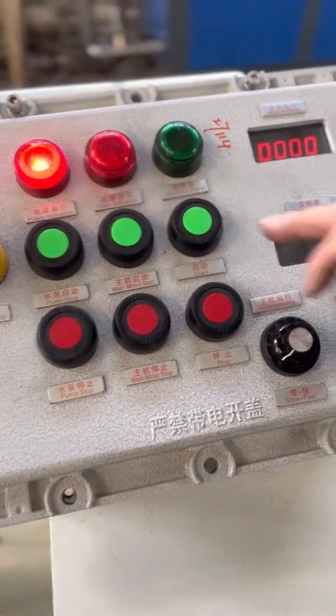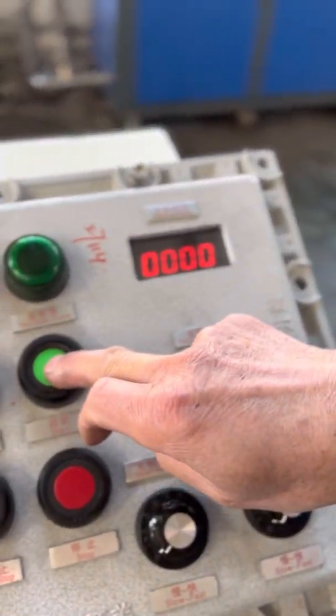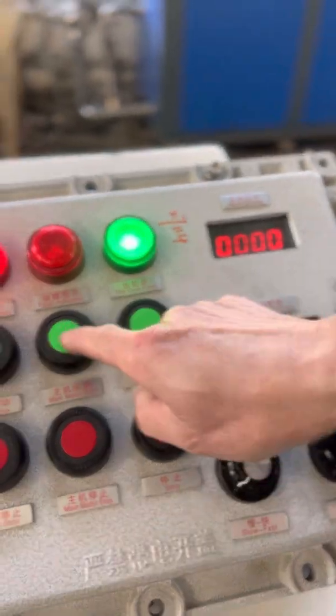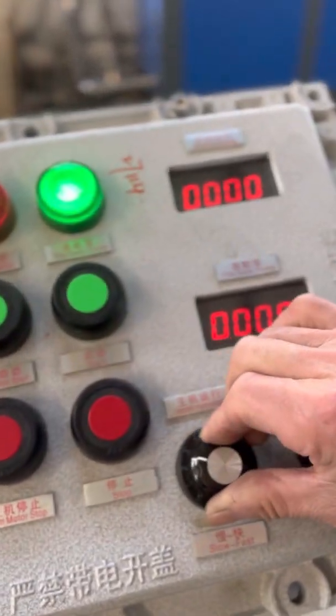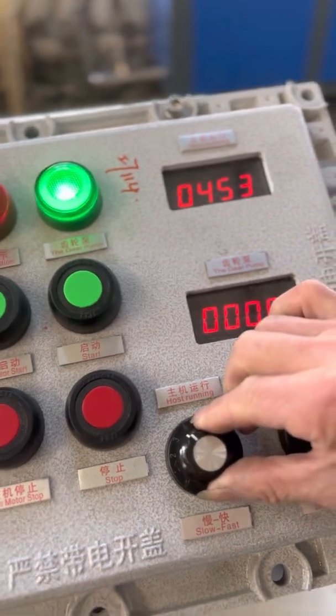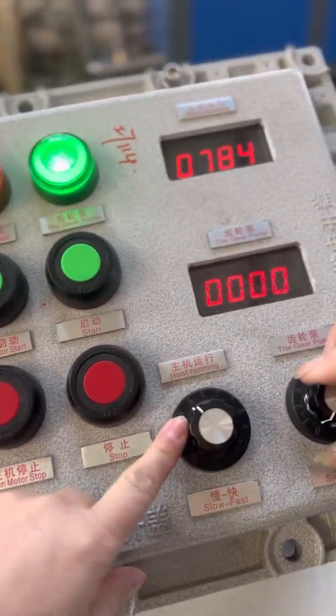And the motor starts. The display shows we can adjust the speed. This is the motor speed.